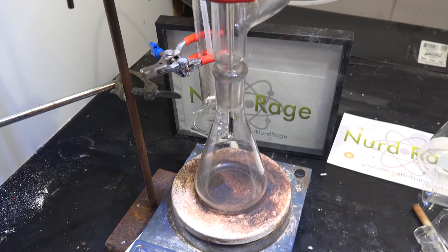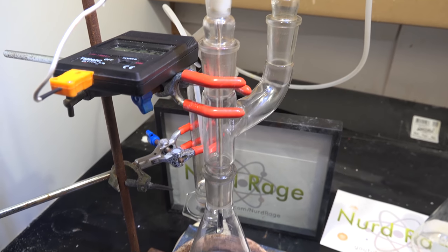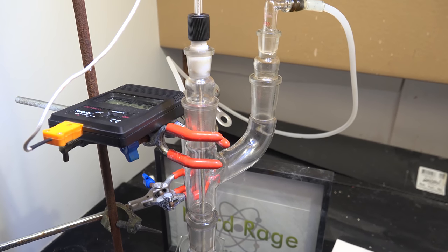I'm using a Claisen adapter so I can connect a bubbler as well as insert the thermometer directly into the reaction mixture.